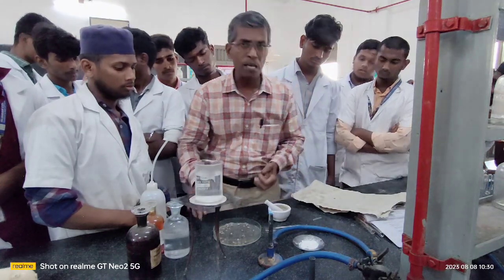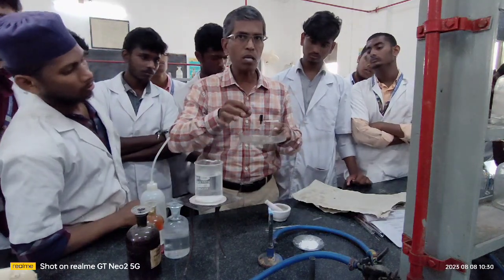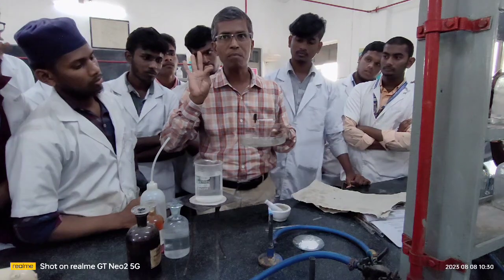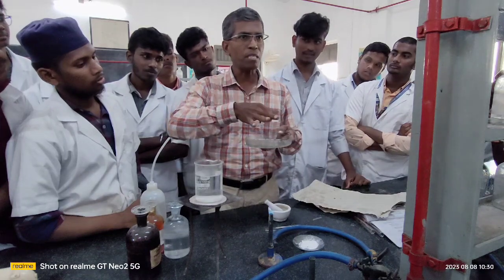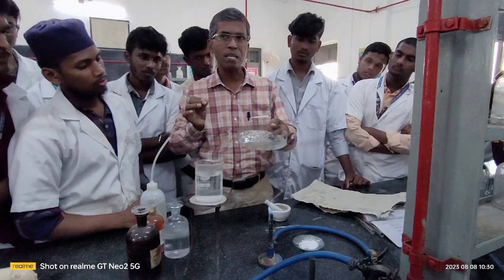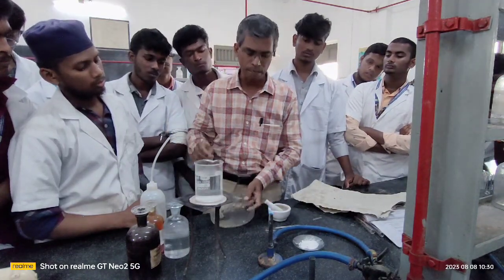Now you take sodium metal. This is your sodium metal, and this sodium metal is always kept in kerosene, not in water. Remember, this is highly explosive when it comes in contact with water. Always this should be kept under kerosene. So the solvent we have is nothing but kerosene, and the remaining is metal.